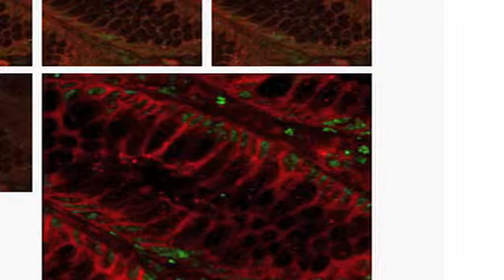I was able to clearly show distinctively that one protein was in one cell and the other protein was in the other cell. Confocal definitely helped me to clarify a point that I've had a problem with for a while.